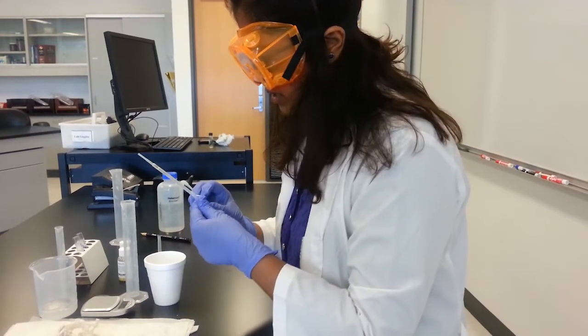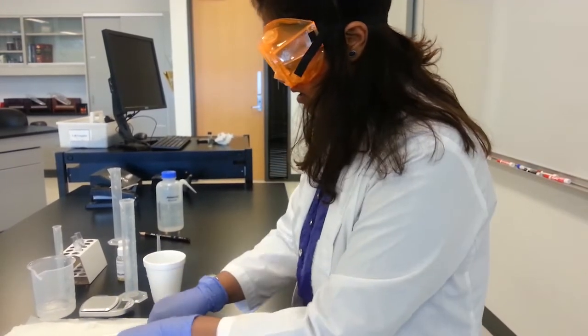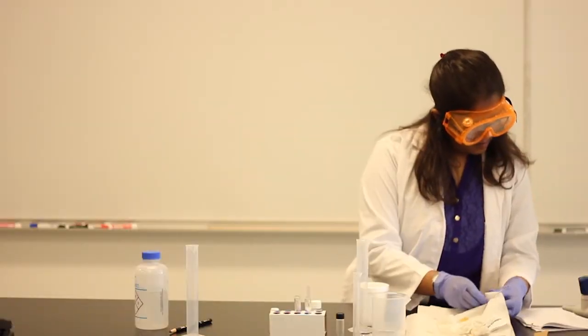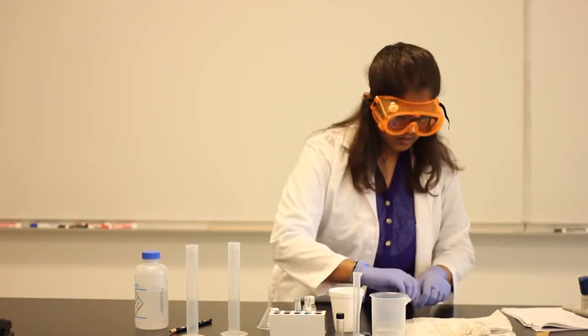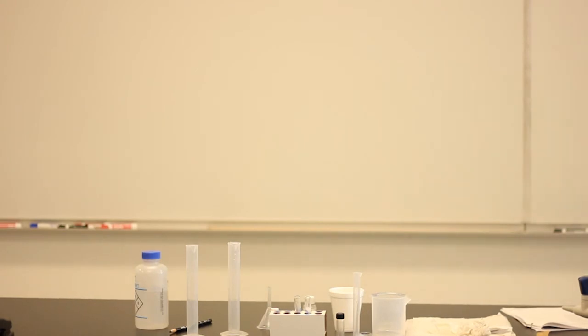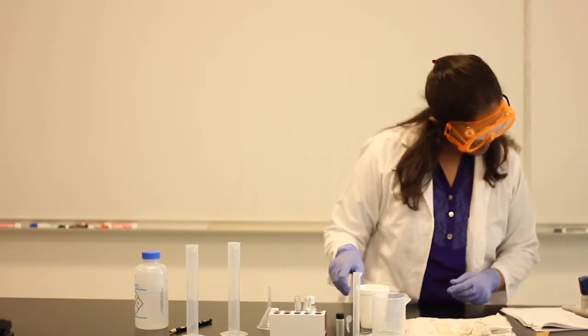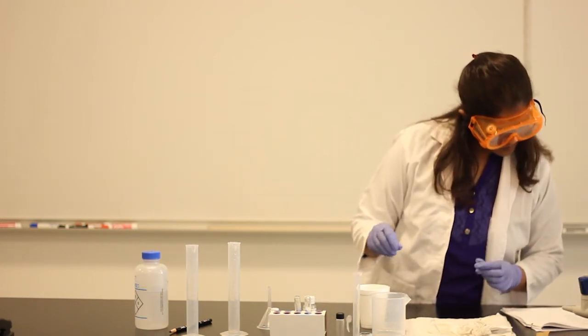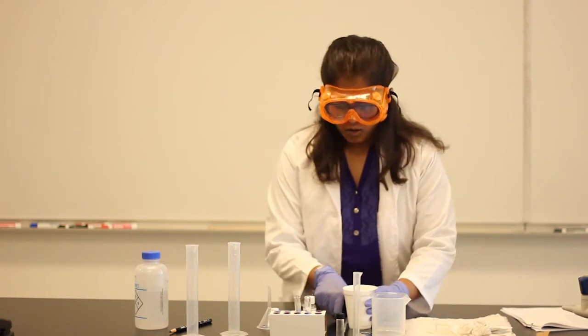So about 20 drops. I took the vegetable oil through this. I cannot use it again. Let me bring just another dropper. Okay, I'm ready. So it's filming, right? Mm-hmm. All right.